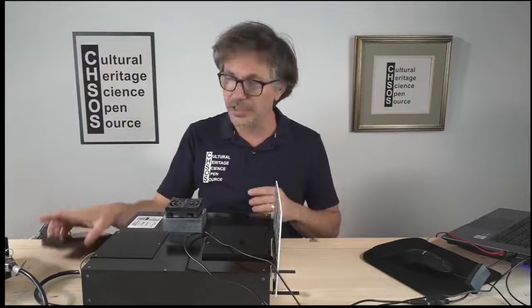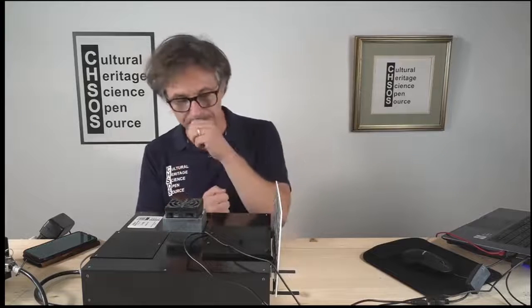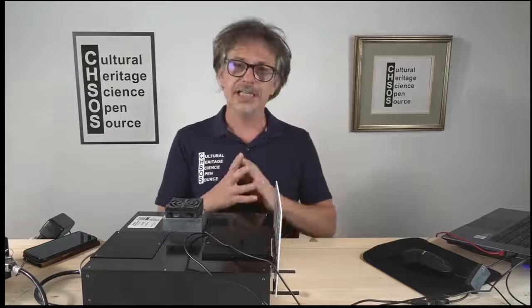Also the lights in the environment: when I did the experiment I turned them off, so this is the actual light we have in the lab right now. Some of these lights, in particular if you have LEDs in your laboratory, will have an impact and even introduce fake peaks in your analysis. Okay, thank you, this is all.